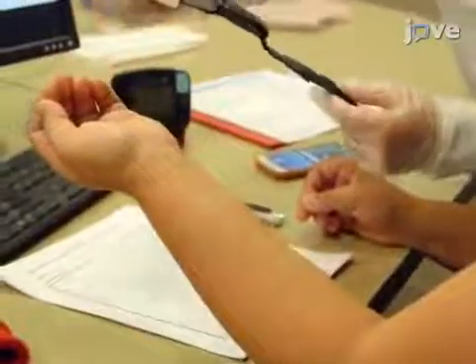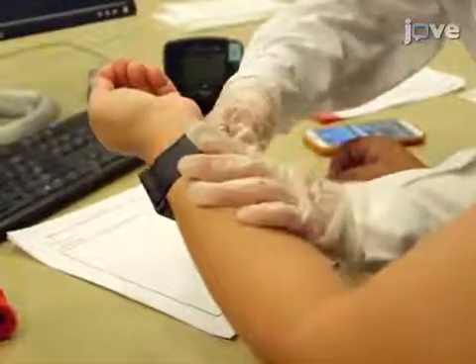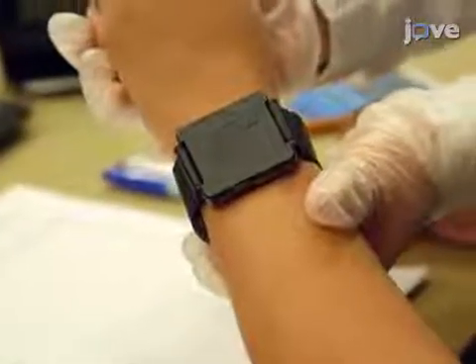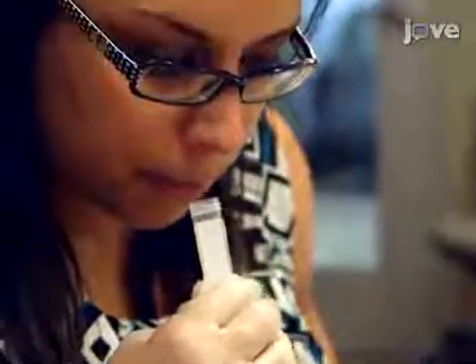Demonstrate how to use the galvanic skin sensor. Then, secure a galvanic wrist sensor to each volunteer, making certain that the sensor straps secure the participant's wrist. Next, demonstrate the proper procedure for salivary sample collection.